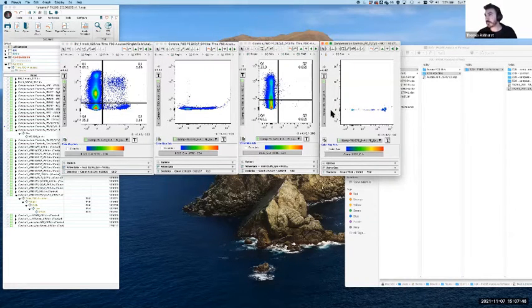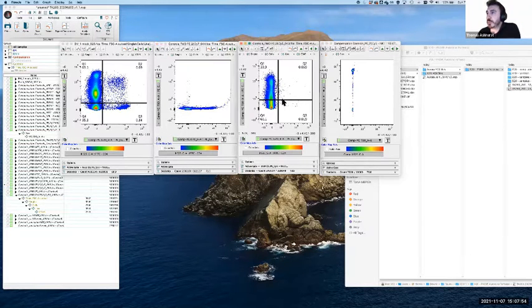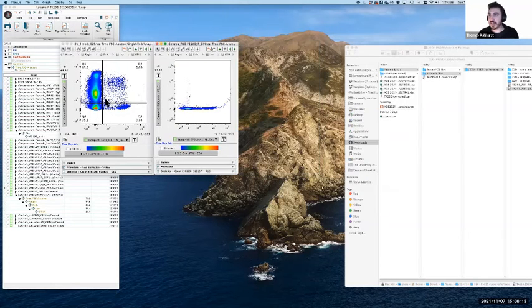So by being able to take the control here versus both FMOs and the single stain control, we get a pretty good idea of how these adjustments are going to correct either over or under compensation, which can make things reasonably straightforward to deal with. It's not the only situation that we come across though. So we had a look at examples of overcompensation, which leads to that super negative, and examples of undercompensation, which kind of creates double positives, which may or may not make sense. And we also looked at how to use the FMO to help us validate the findings.